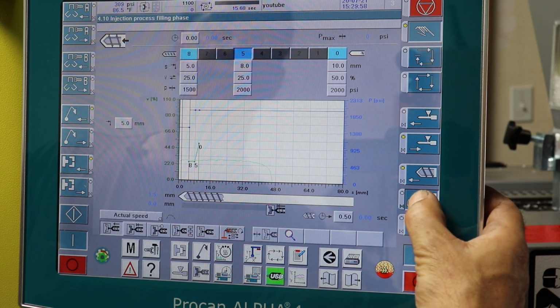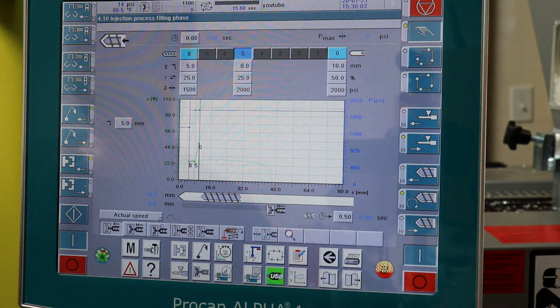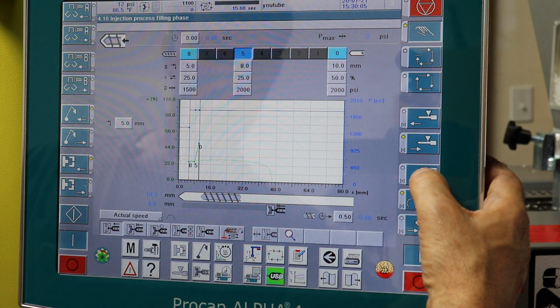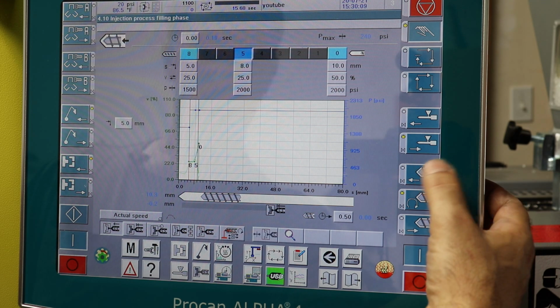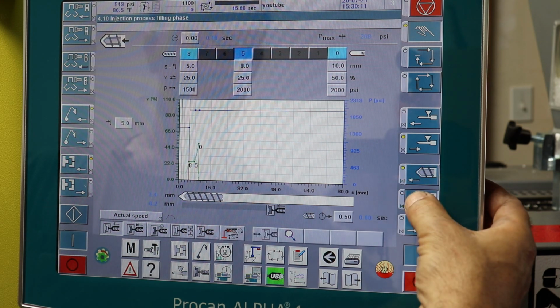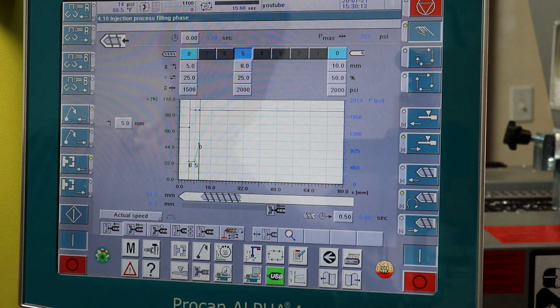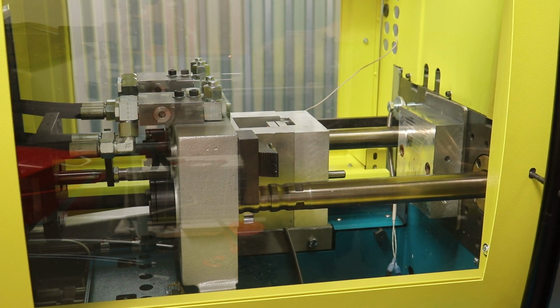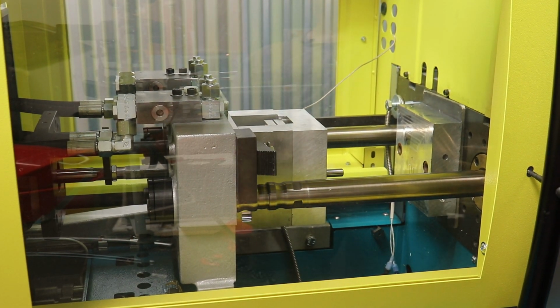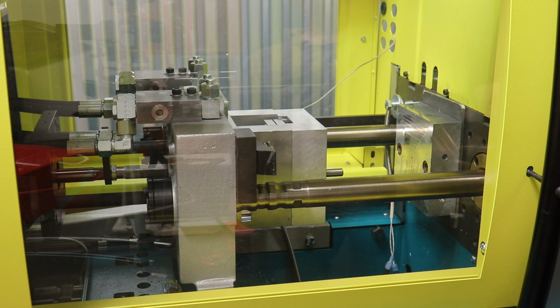And right now we're kind of refilling from the purge, so it'll sound a little crunchy. There we go. I'm going to go ahead and push this out, and we'll do that again. Ooh, got a little squeaky. One more time. Okay. So what I'm going to do now is check that there's no plastic obstructing the nozzle, and let's try shooting our first part. I'm going to hit the semi-automatic button and the cycle start button.